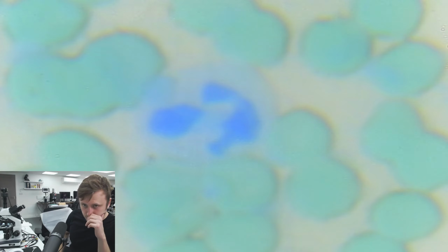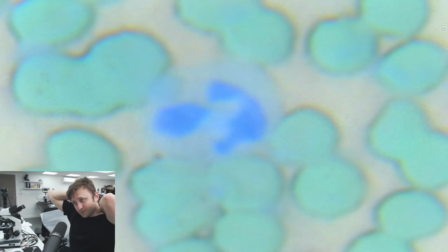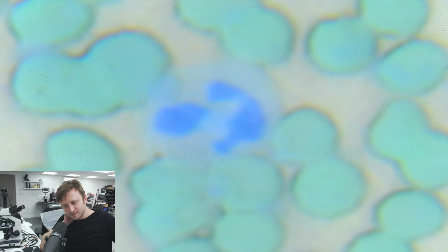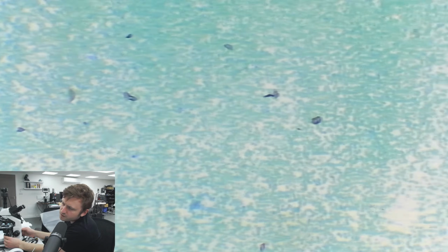So give me a minute. There it is. So that's our neutrophil without the immersion oil. That's as close as I can get at the moment without risking damaging the subject. So if I change the lighting, sure if it highlights the nucleus a bit more. But yeah, it's cool to finally be able to do this. It's quite exciting now. I can continue learning and actually practice it in real life. Let's go to a much more zoomed out view quickly. There we go. Obviously at this distance it's quite hard to pick out any of them.